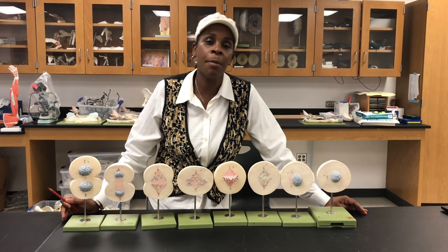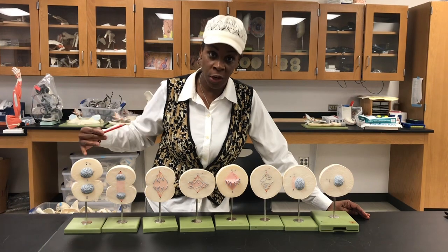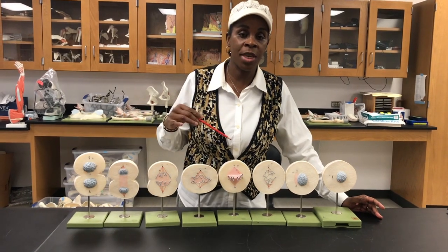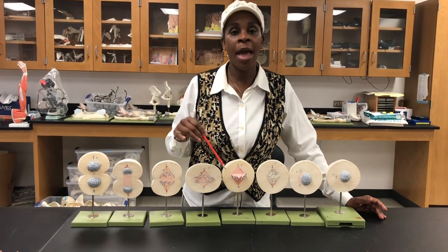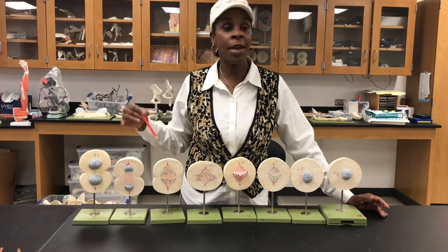Today I'll be presenting about the stages of mitosis. These are cells in different division stages. The acronym, the way to memorize the stages of mitosis, will be the PPMATC. PPMATC, right? P stands for what? Prophase, prometaphase, PP. The metaphase, A, anaphase, T, telophase, C, cytokinesis.